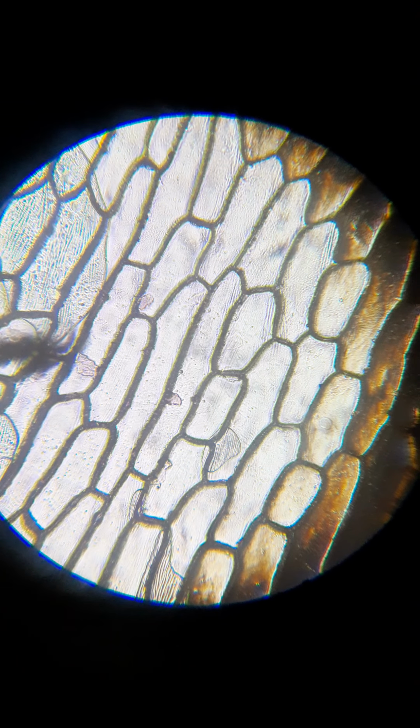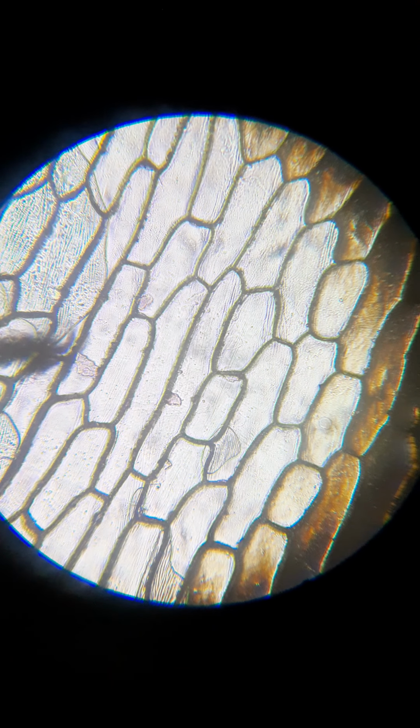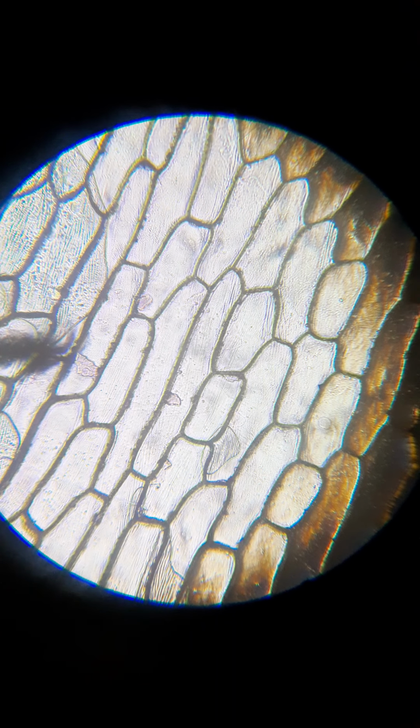Normally I would do some explaining first before I started showing something like this, but as I'm very new to doing these videos, I didn't want to explain something for 5 to 10 minutes and then bring my phone over to my microscope and not be able to get it to work, or something weird happen and all that time be for nothing, because I just don't know how to put videos together yet to make it one continuous thing. So I am going to show you this and explain what's happening, and then I'm going to go to the board and bring the phone up and show you how this affects the body.